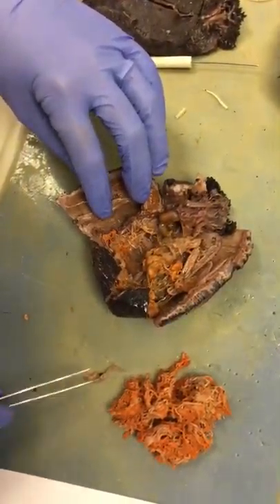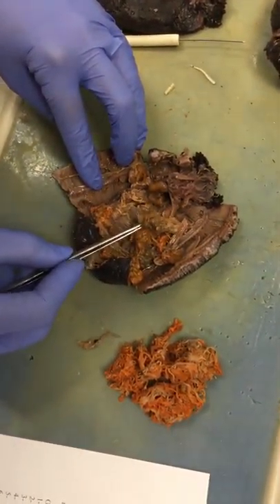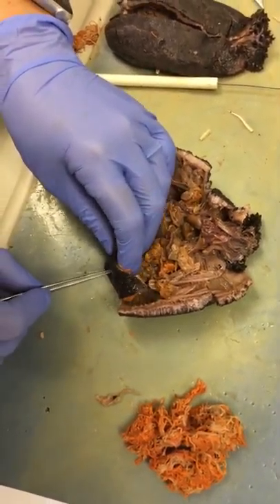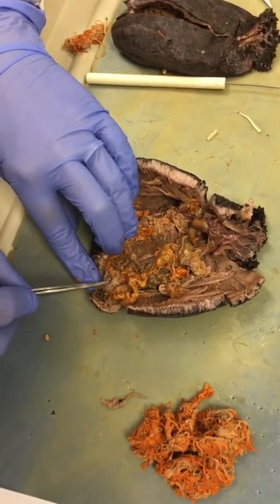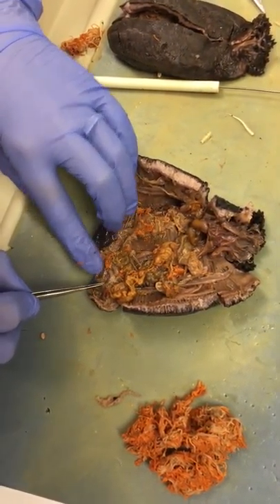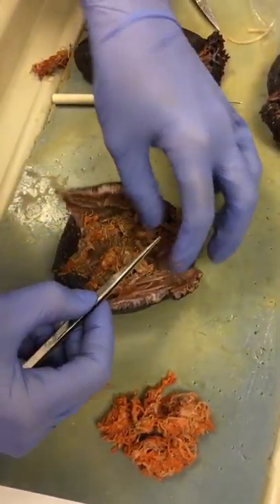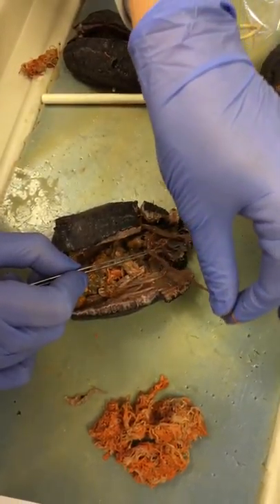You can see the difference between the gonads and the respiratory tree here, and then the intestines all have a slightly different look. This region being the anus down here is going to essentially empty the intestines out the anus, and then this is where your cloaca region will be. The other structure you can see here is this long, darker-colored structure — this is the Polian vesicle.